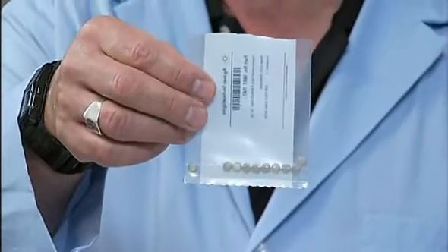So let's first talk about blockage of the inlet frit, which is probably the most common cause of increased pressure. The frits are small, porous stainless steel discs that have porosity usually in the range of about 2 micron or 1 micron, half a micron. So these are very fine filters in their own right. And of course, they can be blocked by particulates that happen to come from the various sources. These types of pressure increases are usually very gradual. In other words, they don't occur within minutes unless something very serious is wrong with your mobile phase or sample. That's right, John. These should happen over a period of a few days, weeks, even months.